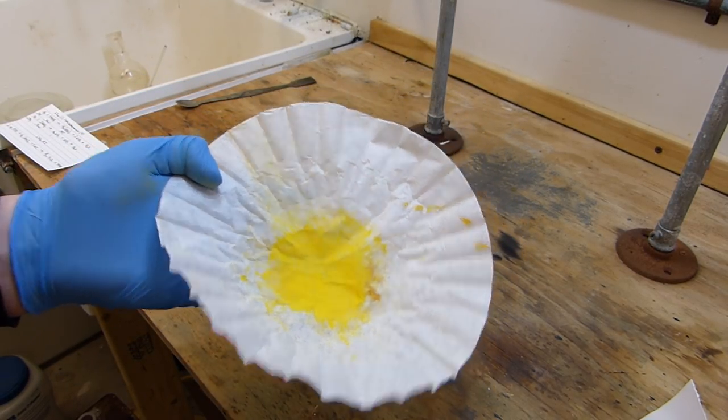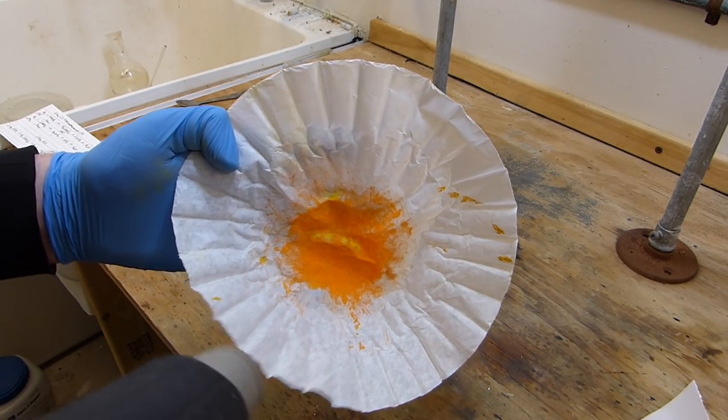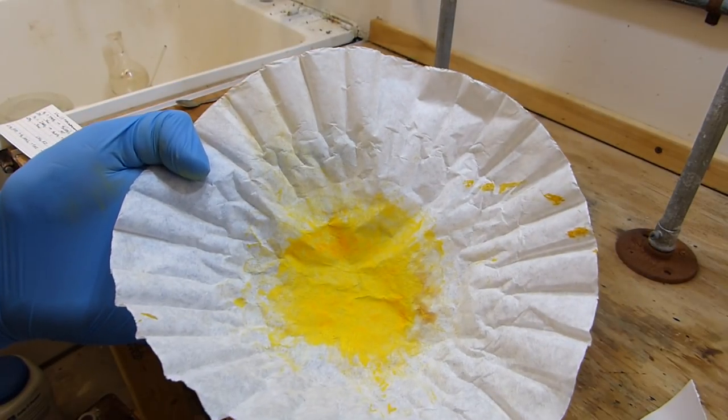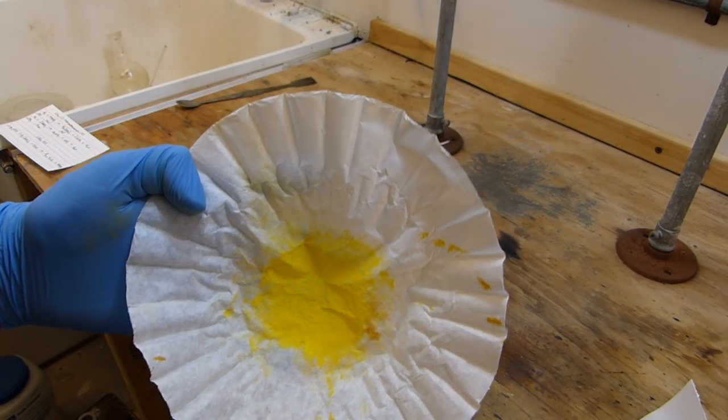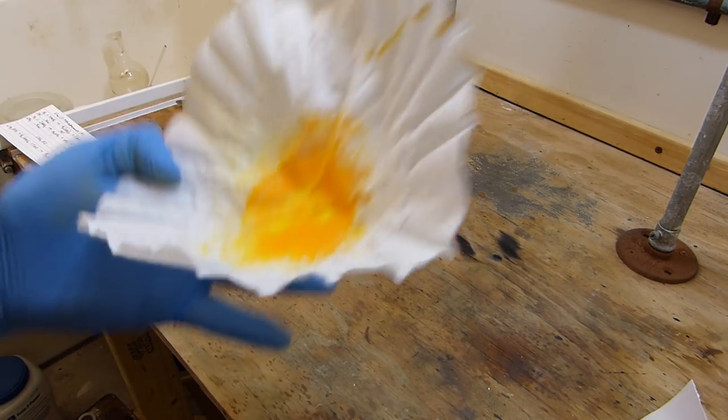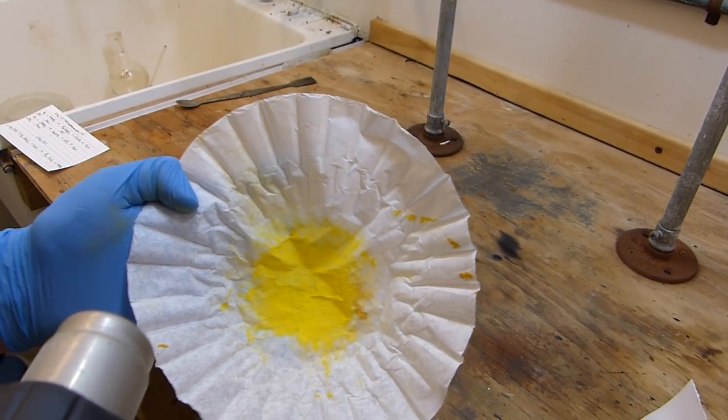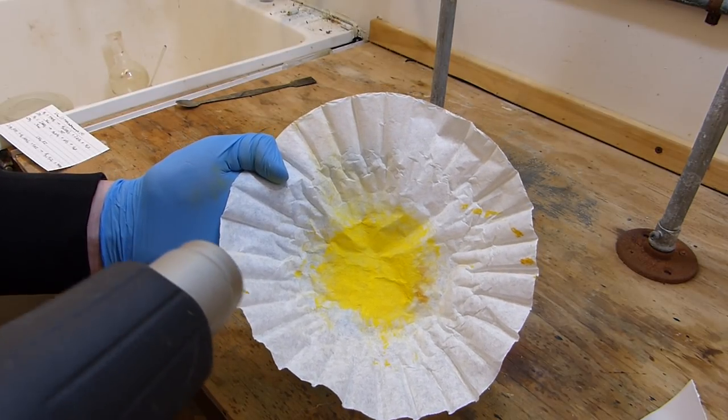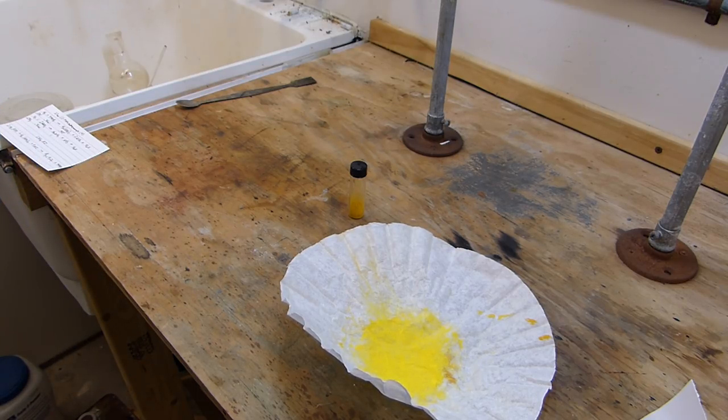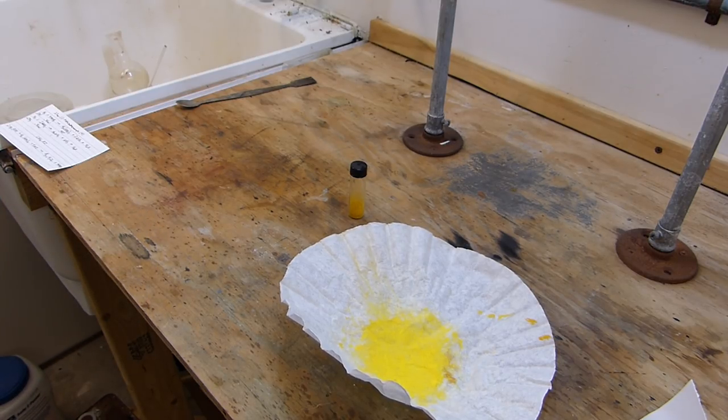We can do that a couple of times right. Yellow, neon orange. Wave it around a little bit. Bright yellow, neon orange, bright yellow. Oh my, heat gun just exploded, did you hear that? Yeah, I'm not really sure what happened there but I believe my heat gun is dead. Well, I'll have to try something else.